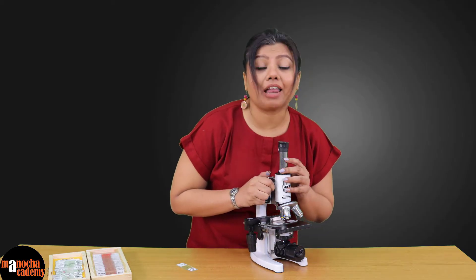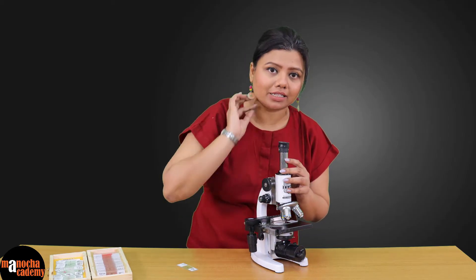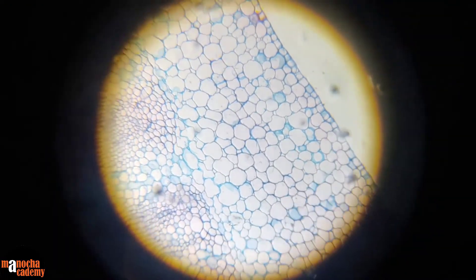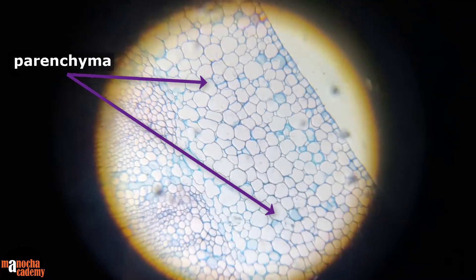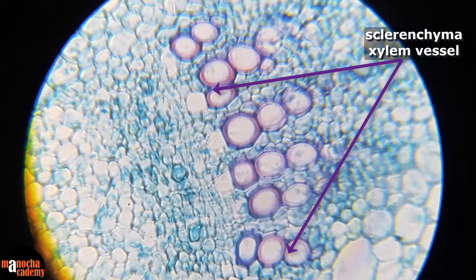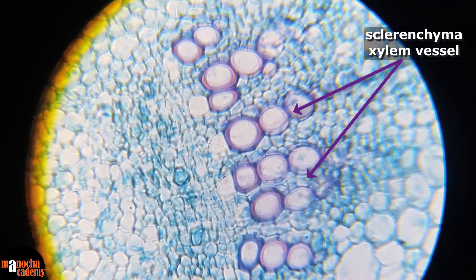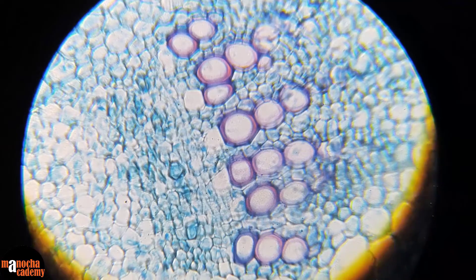In this field we can clearly see the thin-walled parenchyma cells and the thick-walled sclerenchyma cells. This is a transverse section of a stem where I am showing you the sclerenchyma and the parenchyma cells.